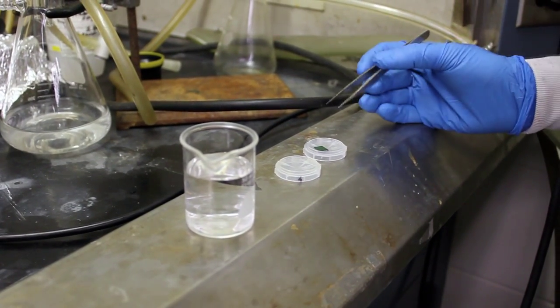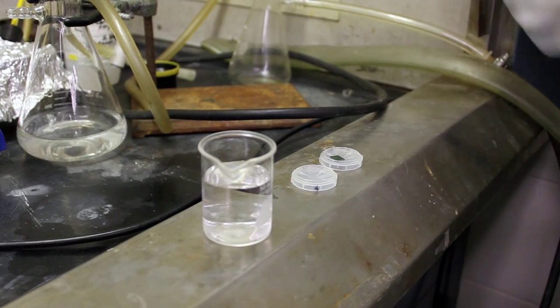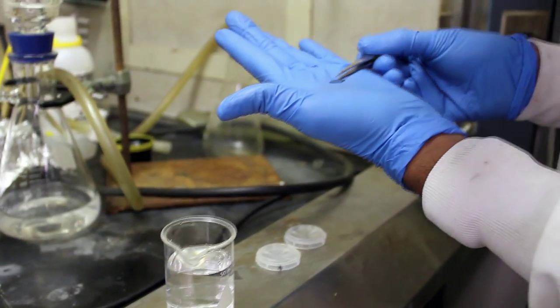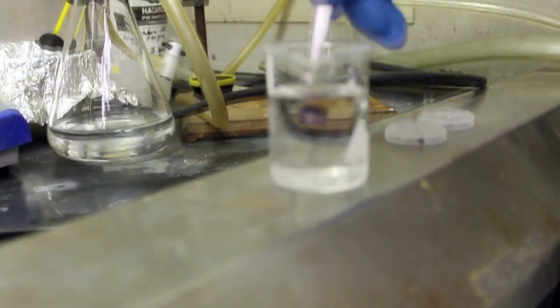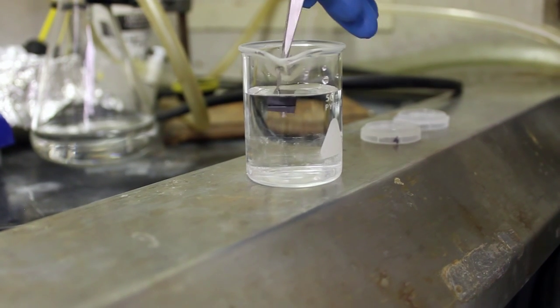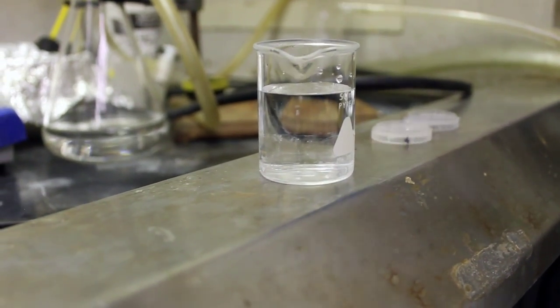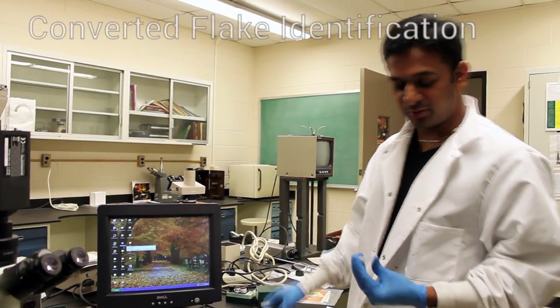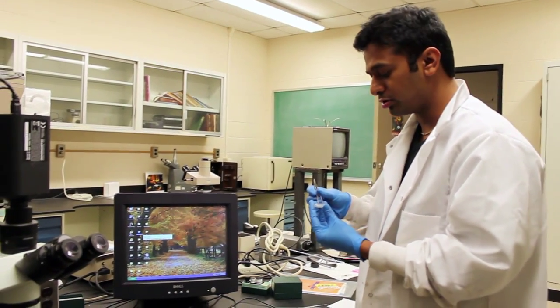Now that the sample is out of the glove box, we wash with water to remove the excess lithium, then blow dry with clean air. It is very important to hold the sample firmly by the edges. We very slowly and carefully wash with water to remove the excess lithium, then blow dry. We are now done with the lithium intercalation and washing process, and need to examine the sample through the optical microscope.